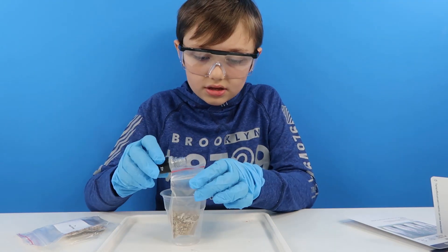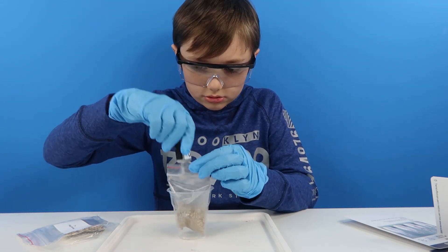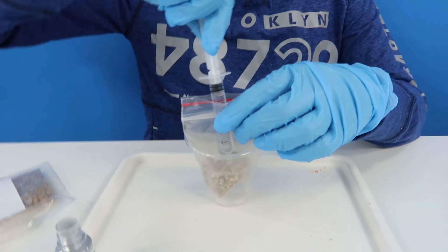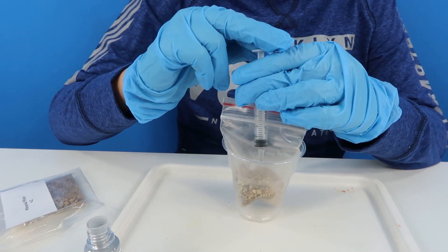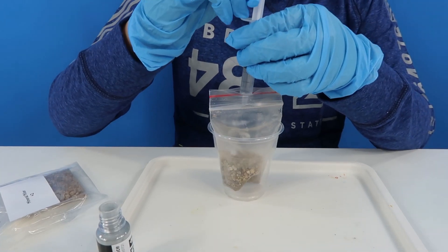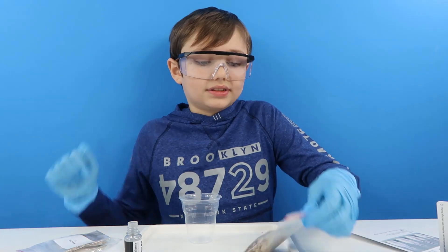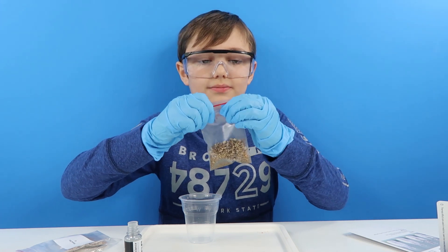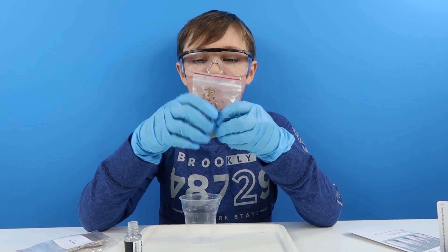Pop this to the side here and tie it on. Now let's put in the water — that'll be six mil. There you go. So now we're going to seal it and mix it, and then we'll apply a thermosticker. Let's mix it — I think it's sealed. Oh, that feels really nice!